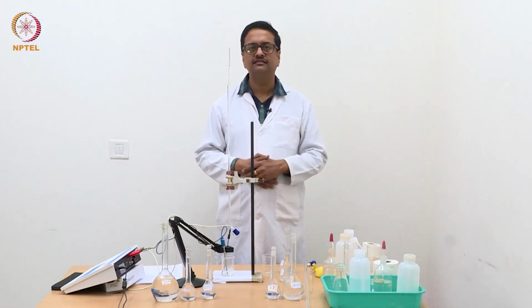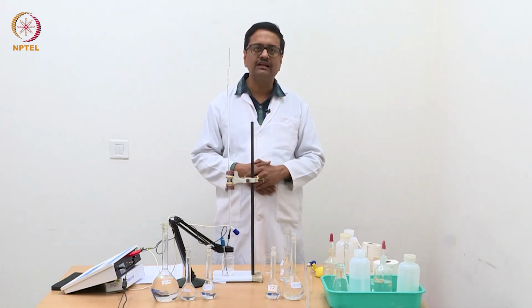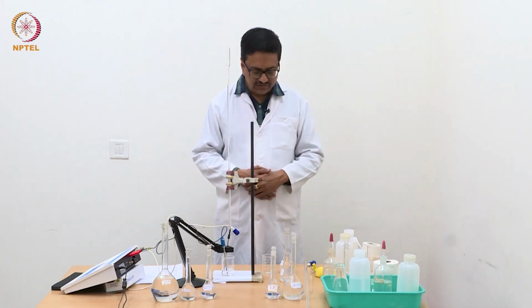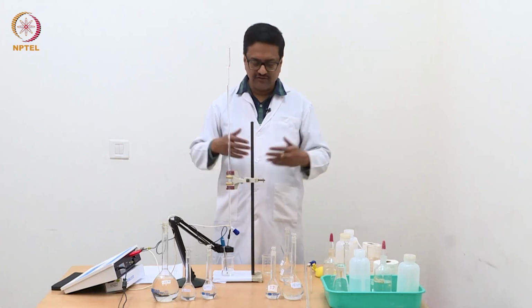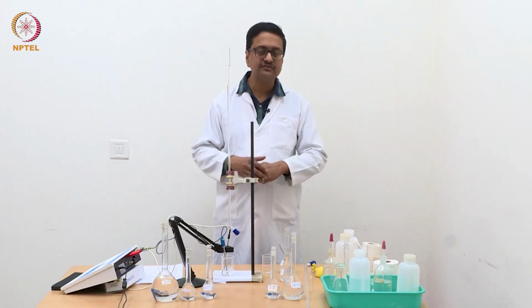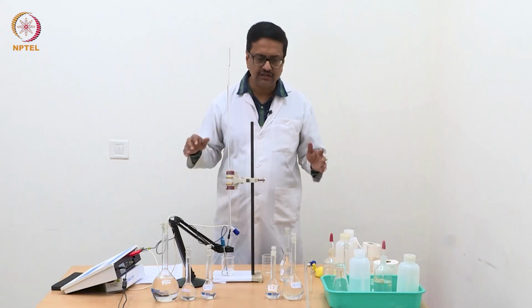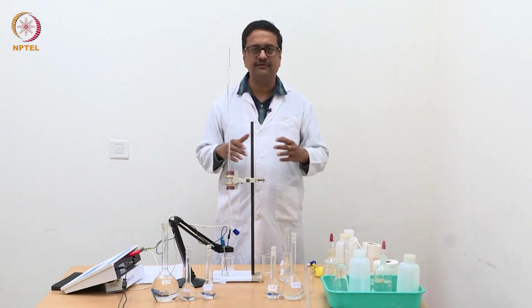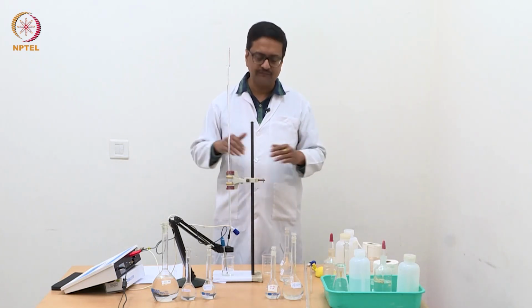Once the H+ ions are completely consumed, NaOH will start hydrolyzing ammonium chloride and produce HCl, and that HCl will react with the added NaOH. So there will be hydrolysis followed by neutralization of the acid produced. We will see that the conductance is not changing as fast as before, but it will reduce slowly.